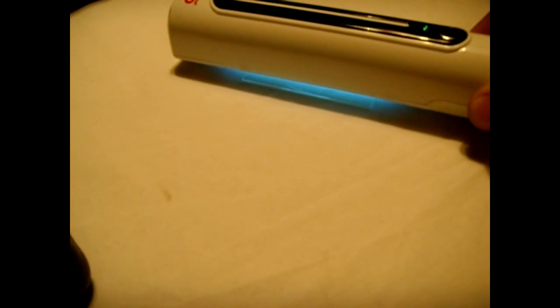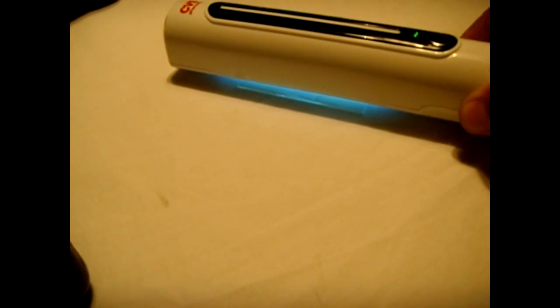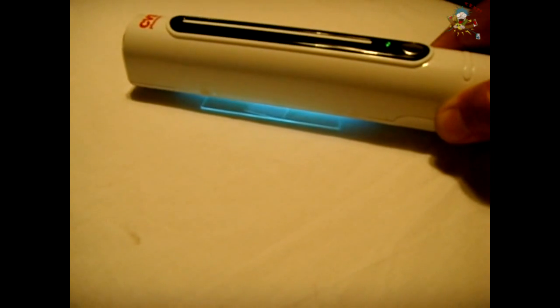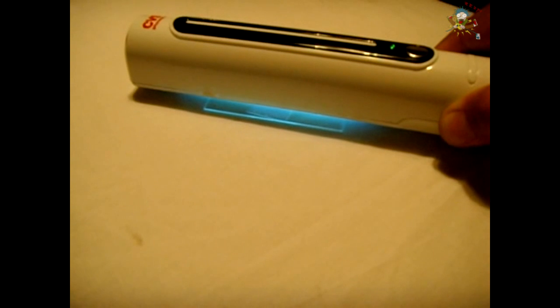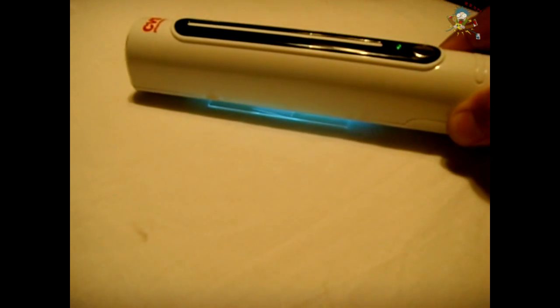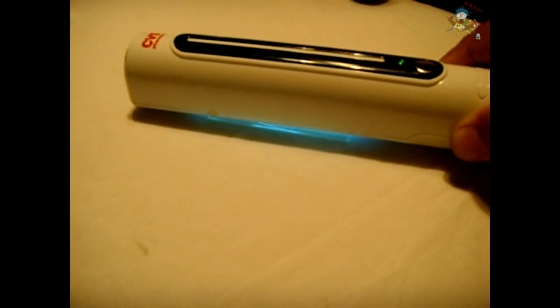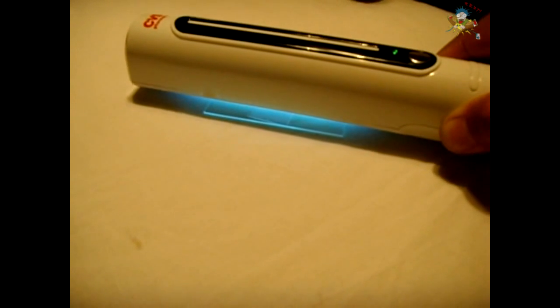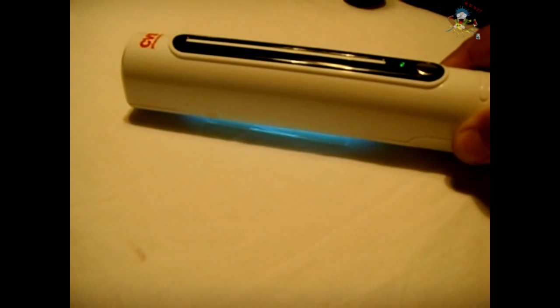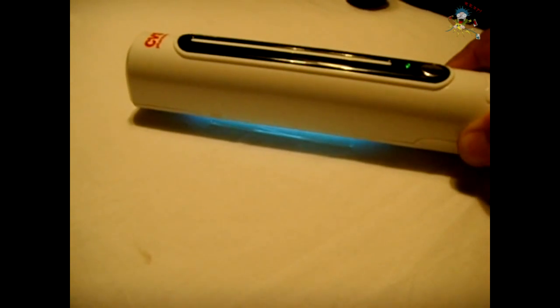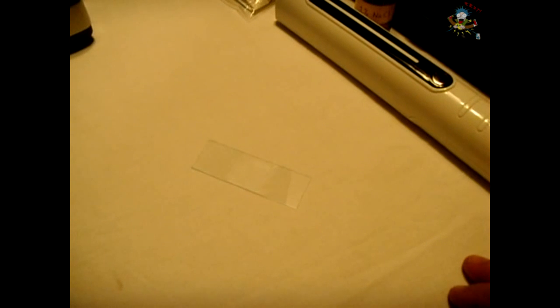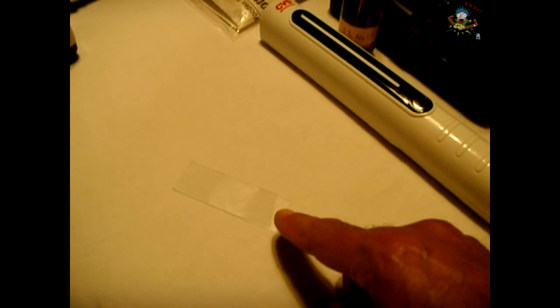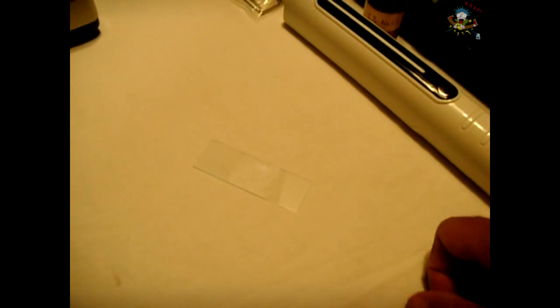All right, it's now on. Let's bring it right over it and we're going to keep that right over that slide for about a minute. What I will do is speed up the video so you don't have to wait the full minute, moving it back and forth slightly at a very close distance, maybe an eighth of an inch, to make sure the entire cover slip is being irradiated with the UVC light. All right, I'm going to turn it off and remove it now. According to the manufacturers of these wands, it kills 99.9% of the bacteria and viruses within 20 seconds to a minute or maybe a little more. So I did it for a little over a minute at very close distance.